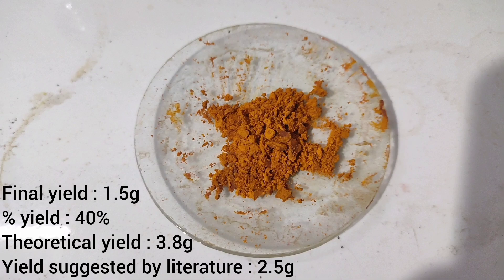The final yield was around 1.5 grams, which corresponds to a percentage yield of 40%.